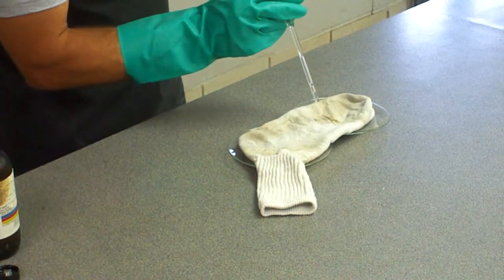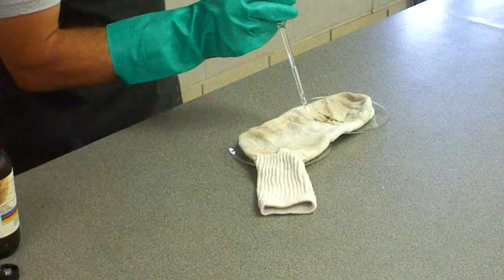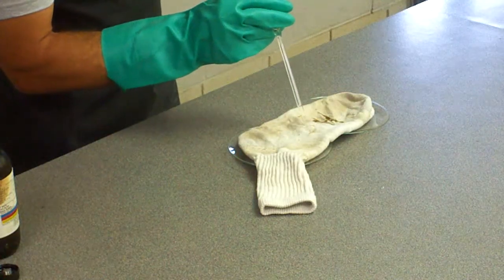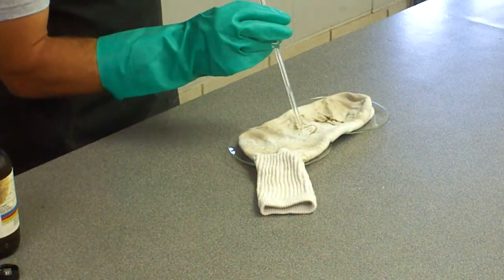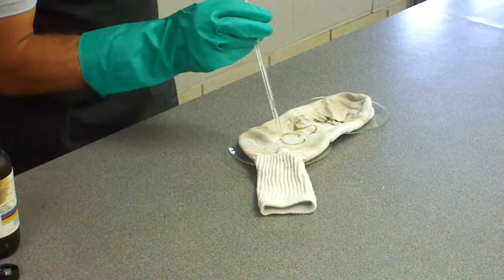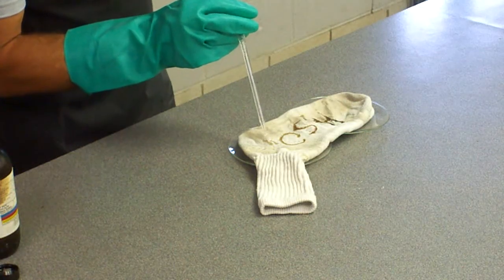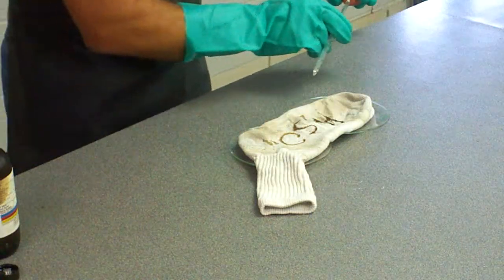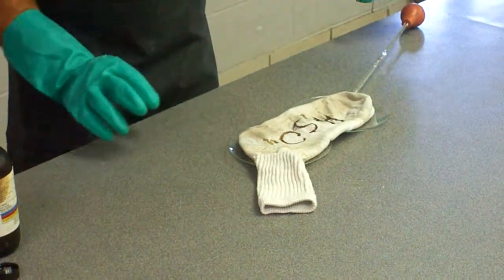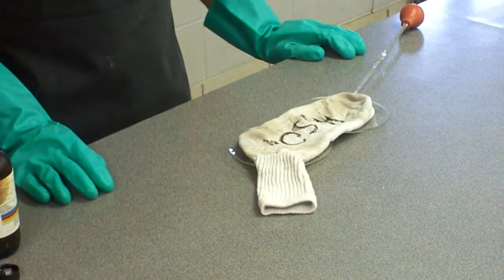It's H2SO4. And by the time I got done with the number 4, you can see on the letter H that sulfuric acid is already completely eaten through and chemically burned the cotton of that sock.